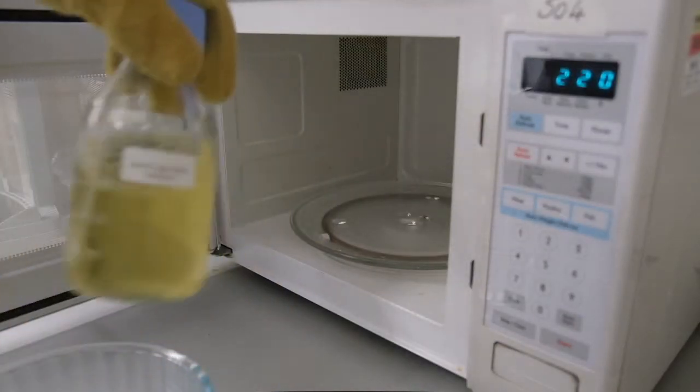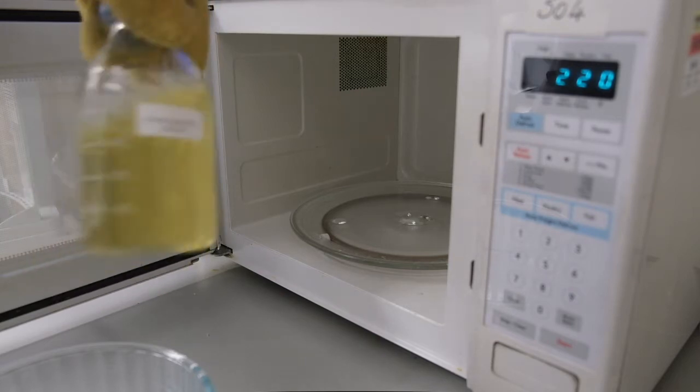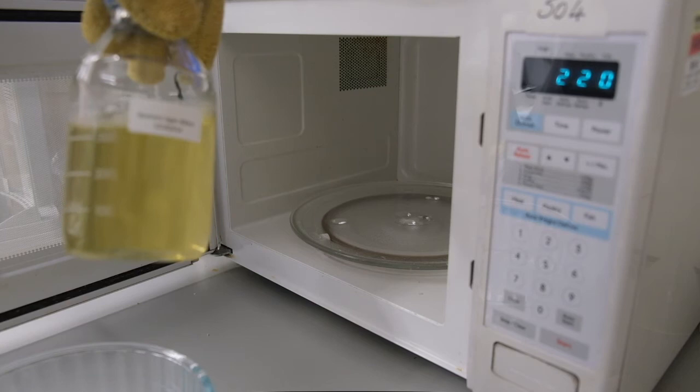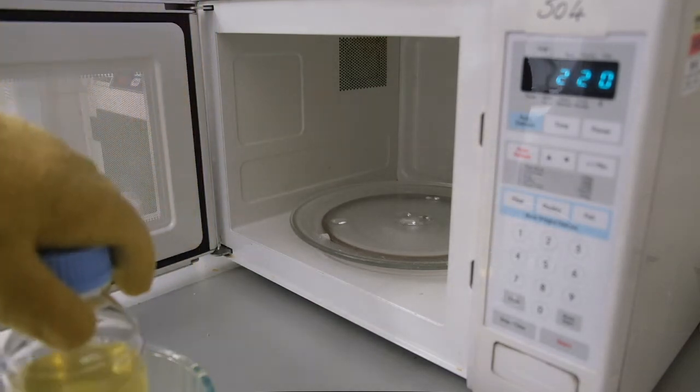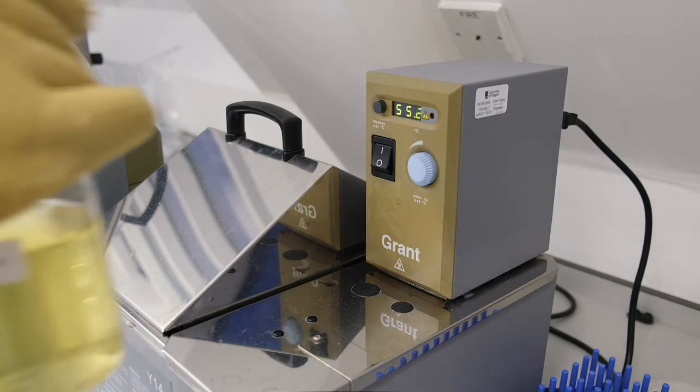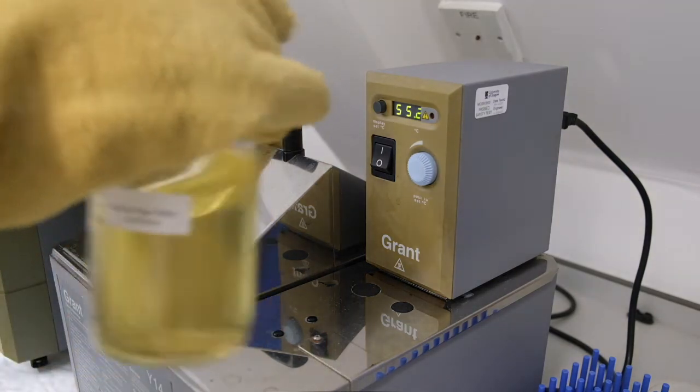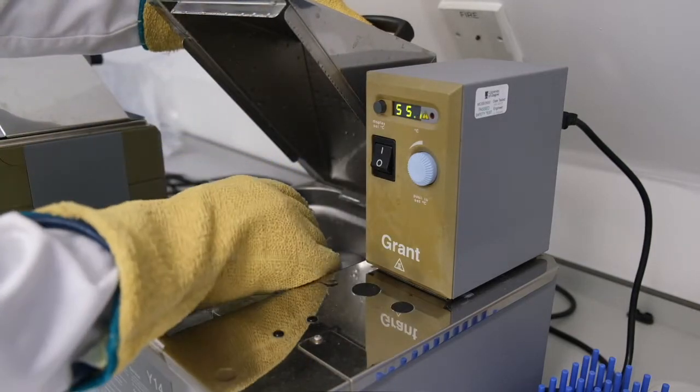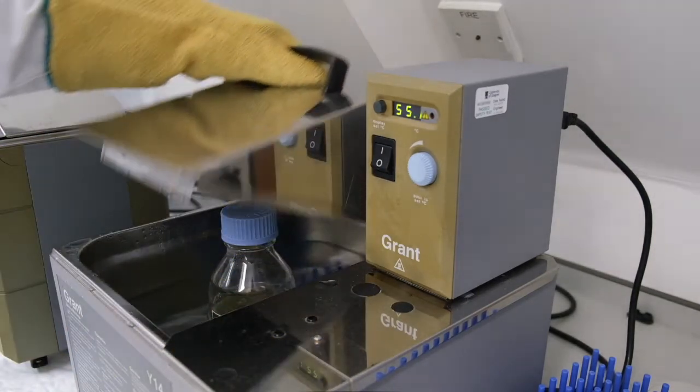Tighten the lid and check carefully that there are no remaining solid lumps of agar. Try not to mix too vigorously as you may introduce air bubbles. After washing any excess agar from the outside of the bottle, we place it in a 55 degree water bath to cool down. We'll leave it here for about 20 minutes.